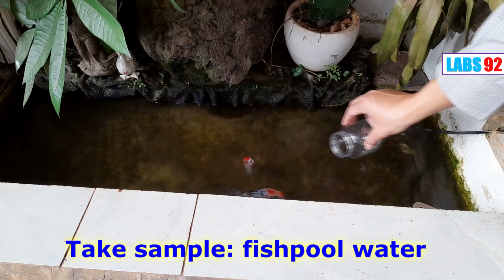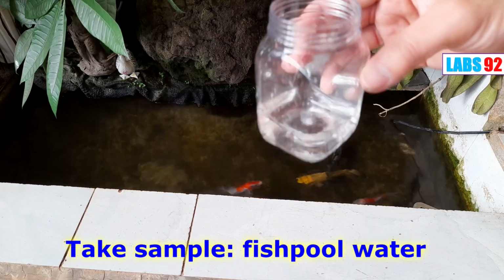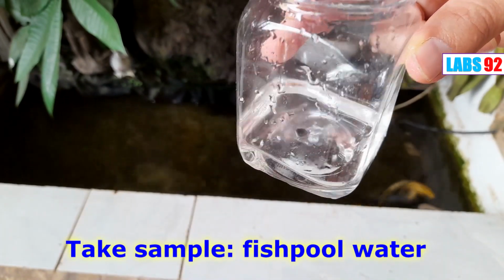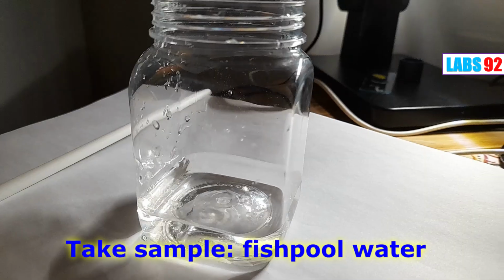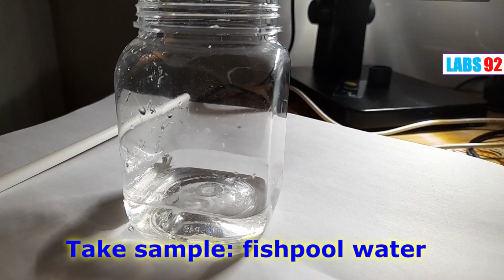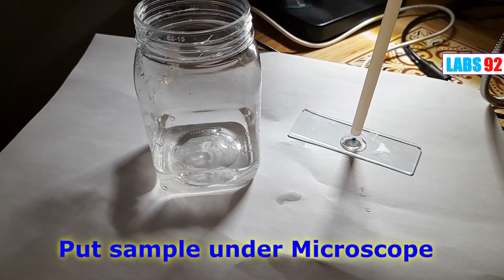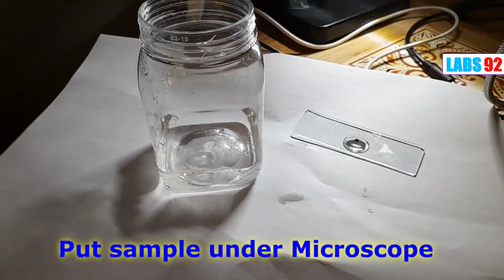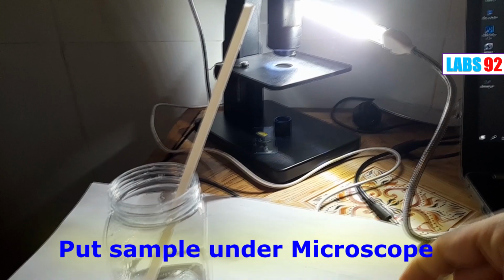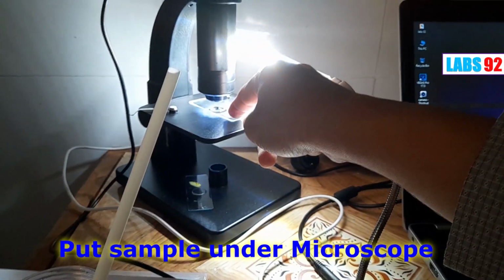First of all, we take a sample. We take a little water and keep it in a small bottle. Then we take a drop of water and put it on the microscope slide. Then we put the microscope slide under the lens. And now let's see what we've got.